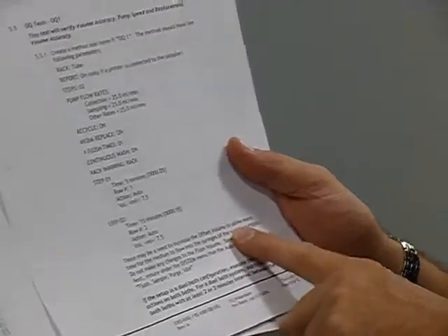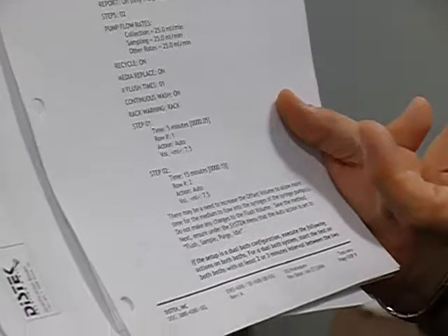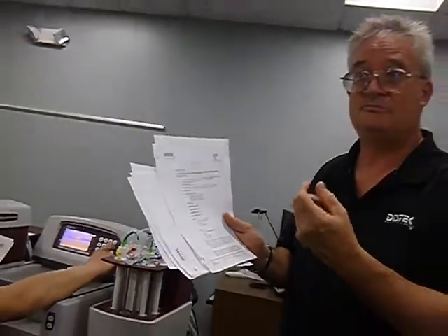But here, it may need an increase offset volume. More than likely, the older units, they were 2 and 3 mil. Now these are 3 and 3.5. Well, it was 2 and 2. We increased the offset to 3. It says 3 mil. It's not actually a volume. It's really a time delay. So when that piston pulls down at 25 mils a minute, it's creating such a vacuum through those vessel lines, and it stops, and that's how long it just sits, waits for all of it to still fill in.